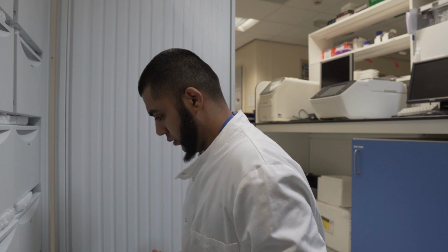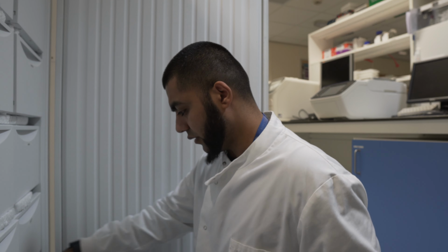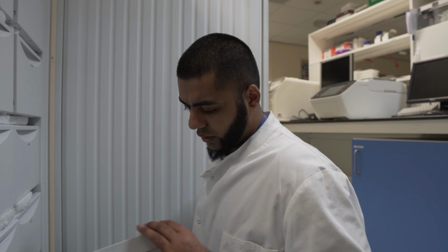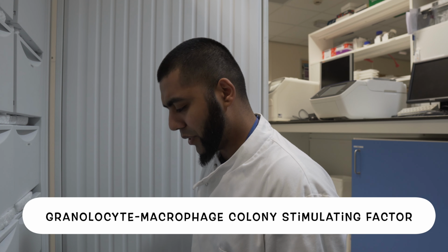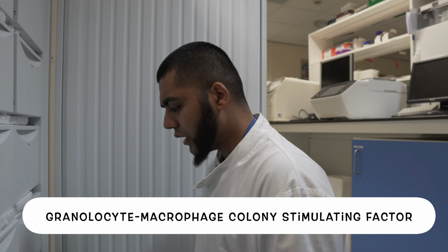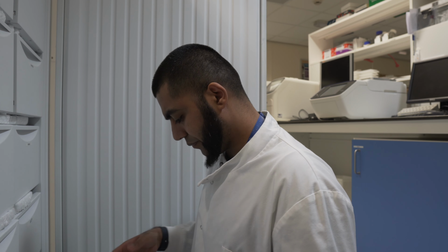So we have TNF ELISA kits. So I do a lot of ELISA. For those who may not know, you might see a lot in the stories for the past 6-7 months, I've been doing a lot of ELISAs. So that's the TNF cytokine. Then I've got the GM-CSF. Again, I forgot what it stands for actually. I'll put it here. But again, very potent cytokine that gets released in the early phases of mast cell degranulation. So that's a very important cytokine that I look at.